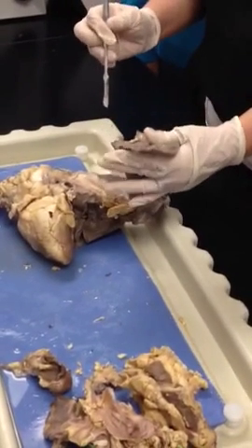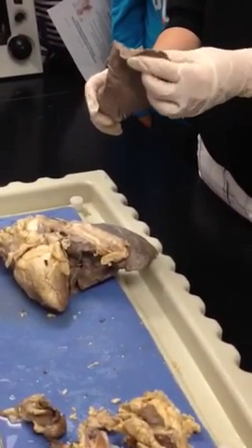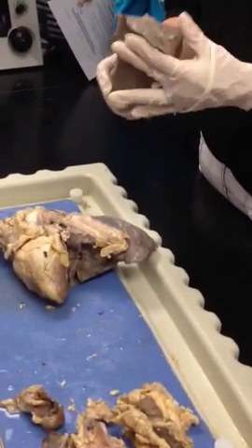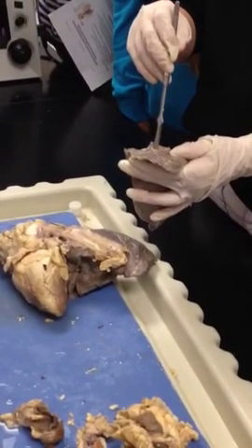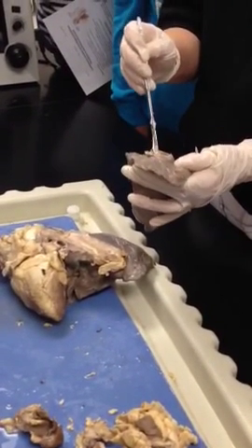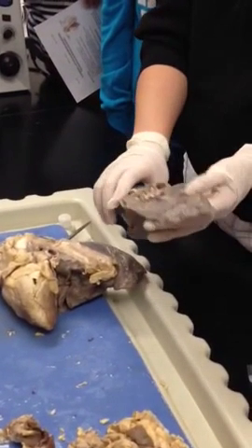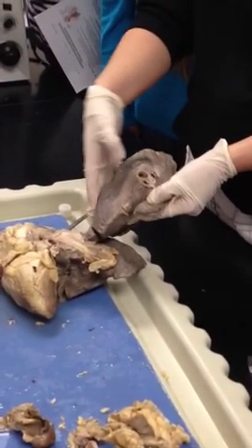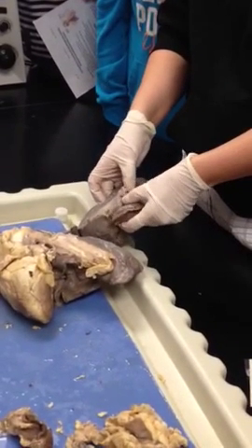Another thing to realize is, all right, what lobe is more superior when we're talking about the sheep lung? It's a smaller lobe, right? So that's superior. The pulmonary artery is also more superior than the pulmonary vein, and it's also above the primary bronchi. Okay, does that make sense? So you have your primary bronchi here, okay? Is there a probe in there? So I'm not poking this with the scalpel.